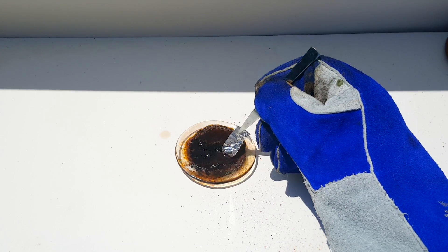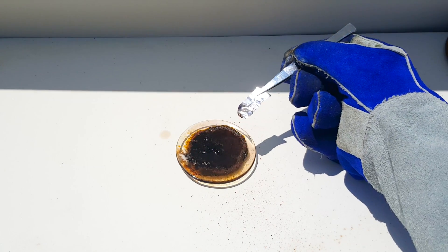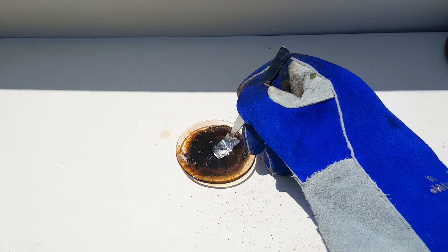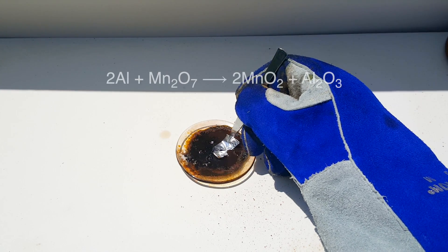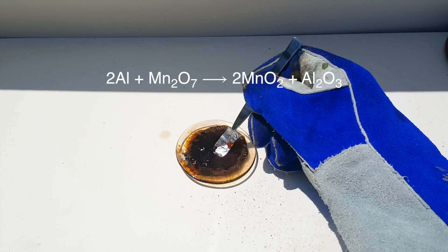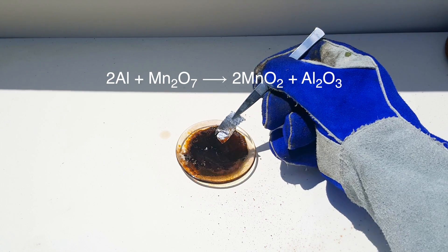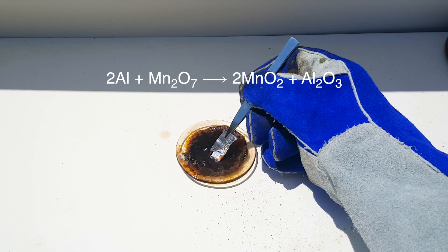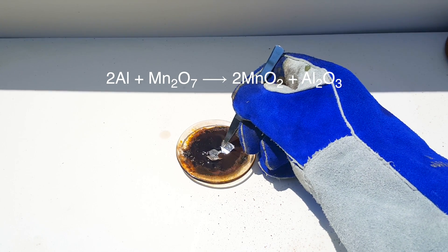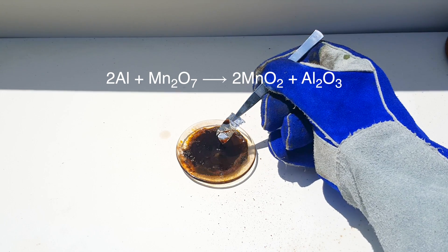Immediately after reacting the cotton, I wondered what would happen if you added a semi-reactive metal, such as aluminum, to the Manganese Heptoxide. Theoretically, the aluminum would be oxidized as shown to form aluminum oxide. Although this reaction did occur, it was far less spectacular than I had anticipated.